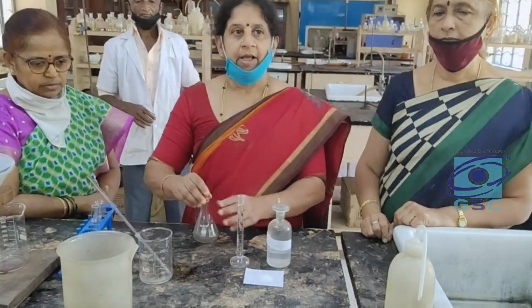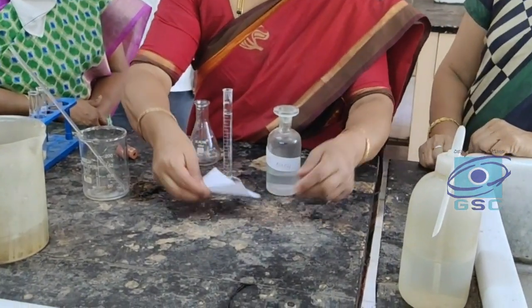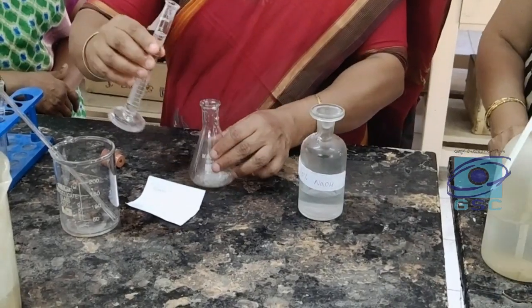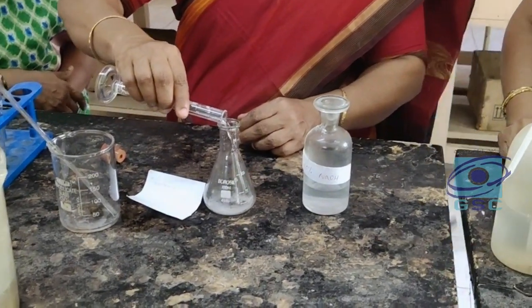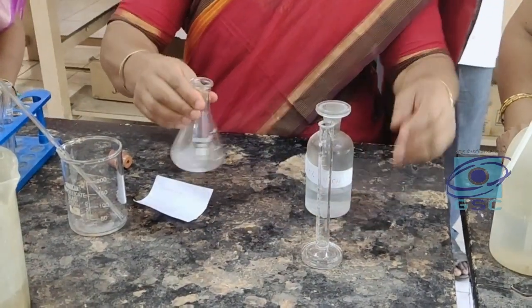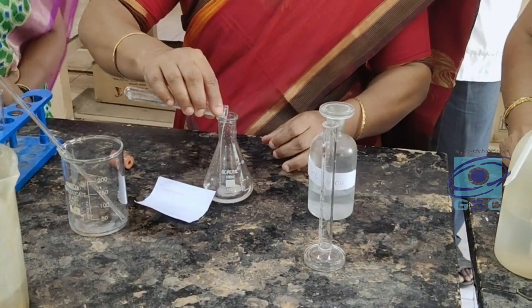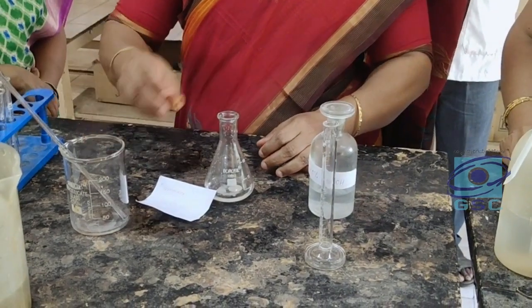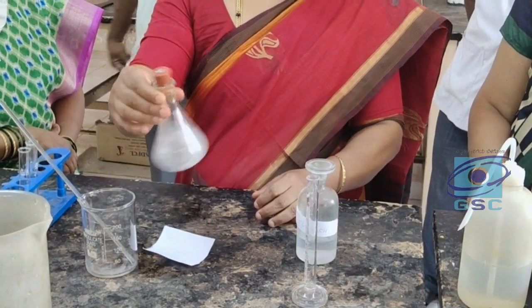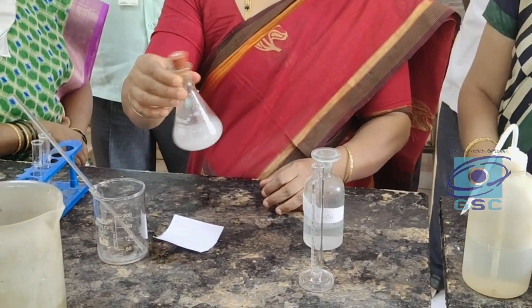I will start with the preparation. 1.1 gram of glycine is taken in a conical flask. Now, 10 ml of 10% sodium hydroxide solution is added to it to dissolve the glycine. Now, 1.5 ml of benzoyl chloride is added to the flask. Close the conical flask with a cork and shake the contents vigorously till the smell of benzoyl chloride is no longer detected.